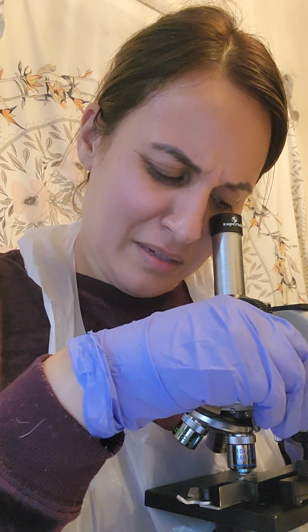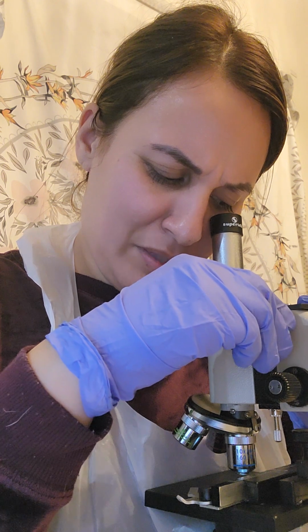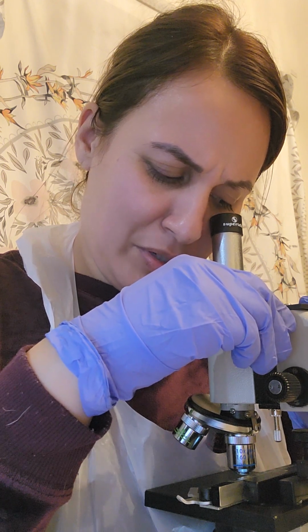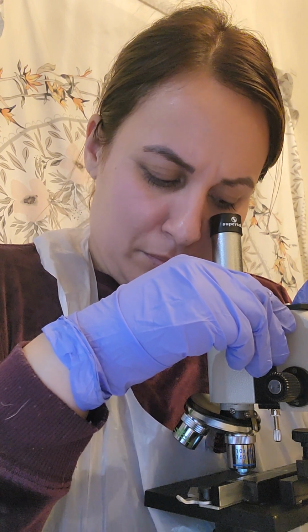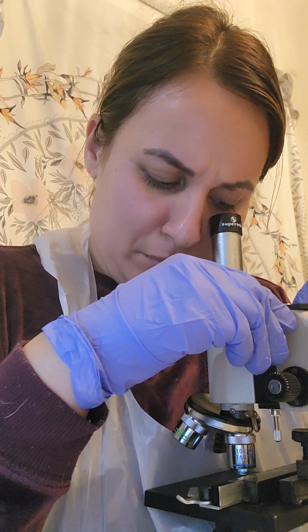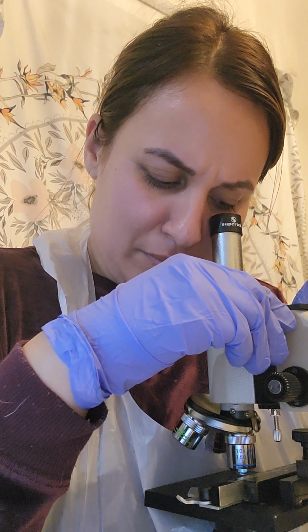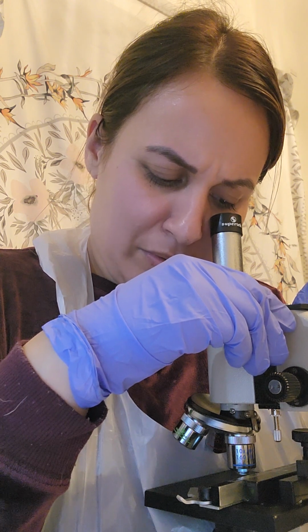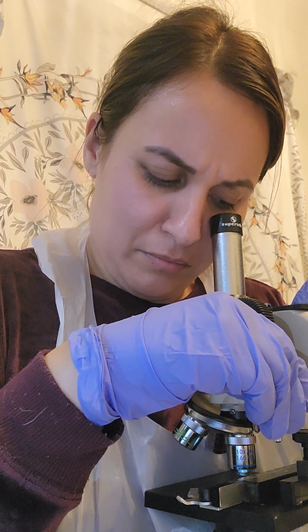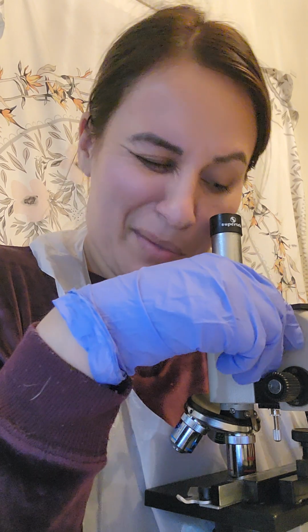It looks like it was gram stained with a little bit of that purplish colored one. And it's like one strand. And then there are different particles. Okay, then we're going to go to the high power. This again looks like mossy.